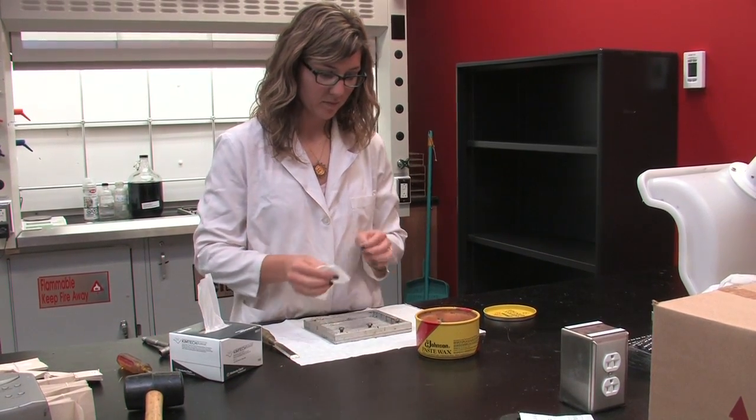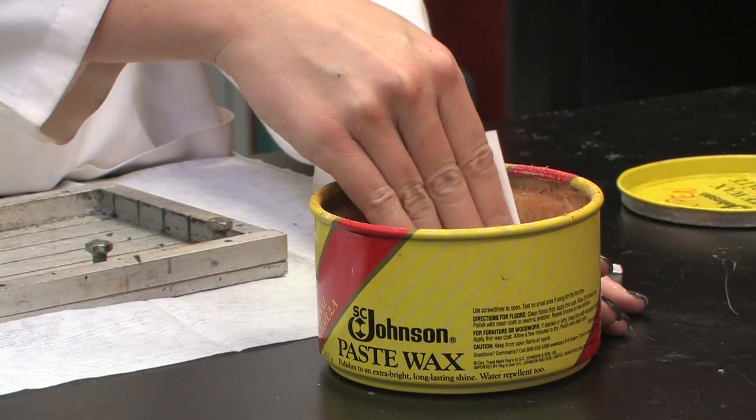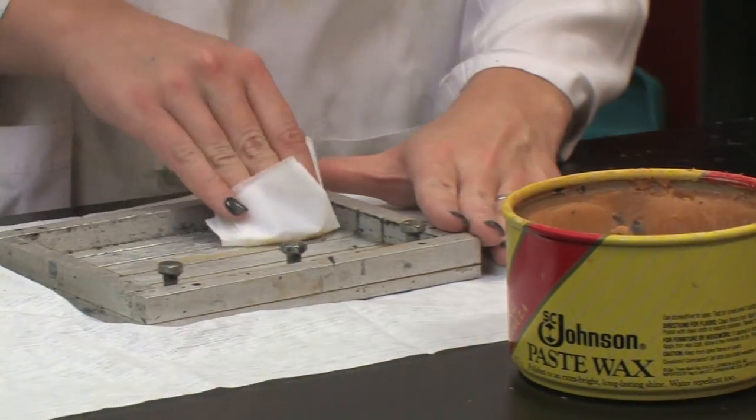We grease the molds with a paste finishing wax. We use Johnson Paste Wax. This acts as a releasing agent.